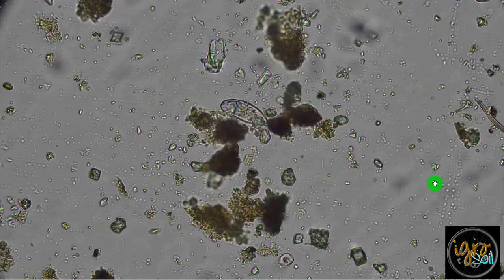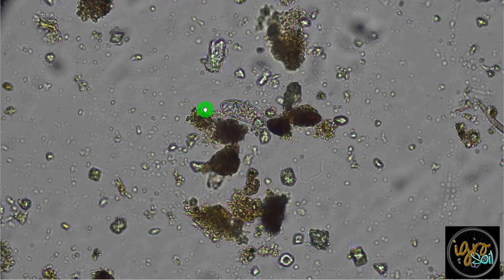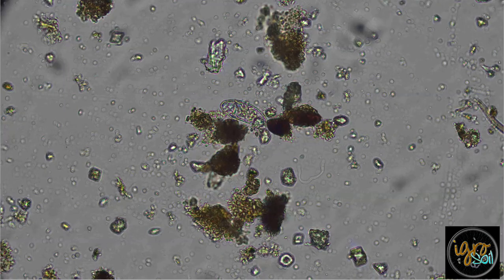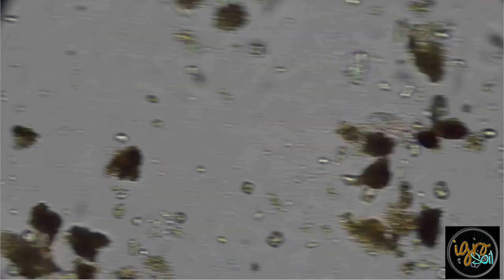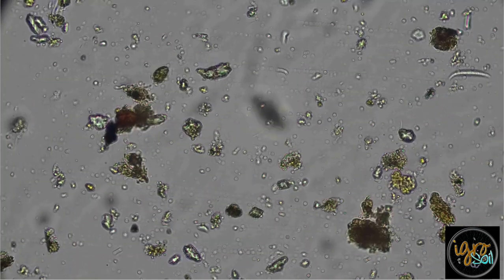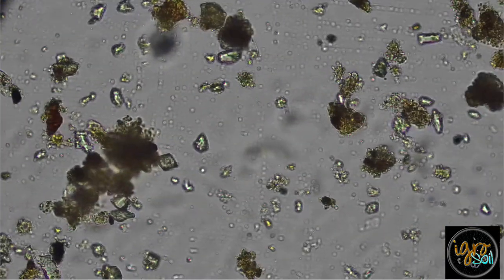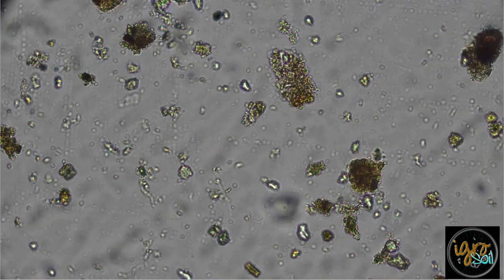So there's a little more life in this slide, right here. But you need a lot going on. You have no fungi in here. There are no hyphal strands in here, which is very important. You need to get the right fungi in here, and you've got to outcompete this Fusarium, and you're gonna outcompete that with biocontrols.